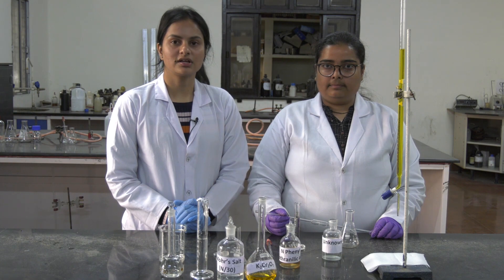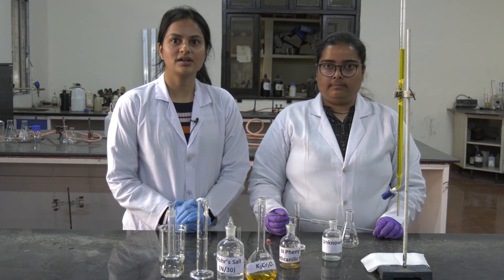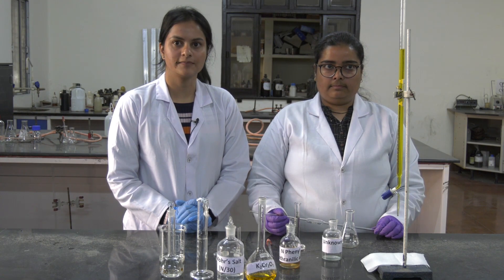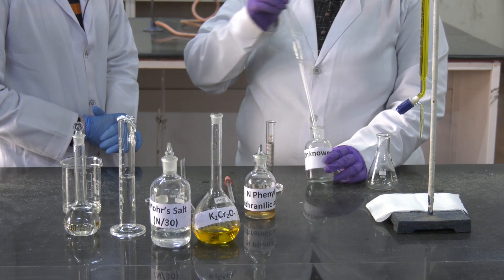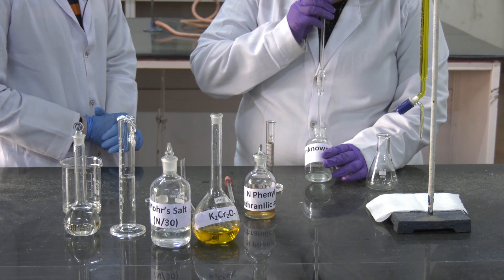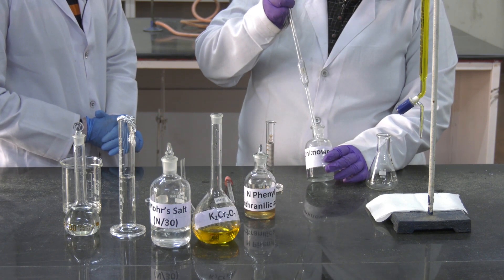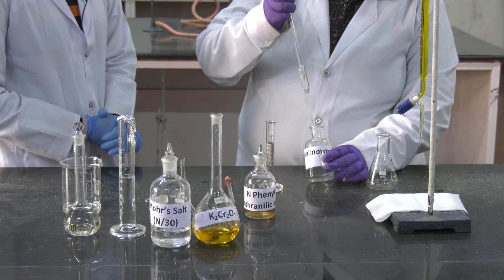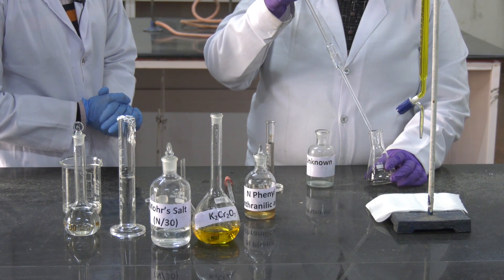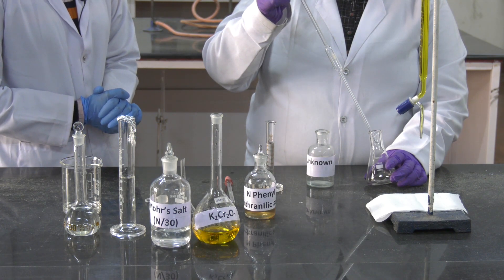Now we have to titrate the unknown solution of ferrous ammonium sulphate salt against a known concentration of aqueous potassium dichromate. To begin, suck 10 ml of the unknown solution of ferrous ammonium sulphate using the pipette. The pipette is graduated here, so you have to suck it till this level only. Then pipette it out into a conical flask.